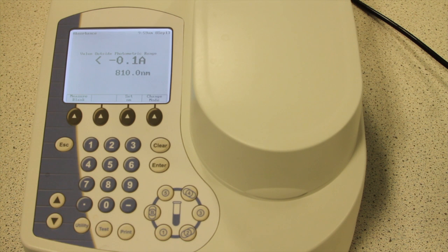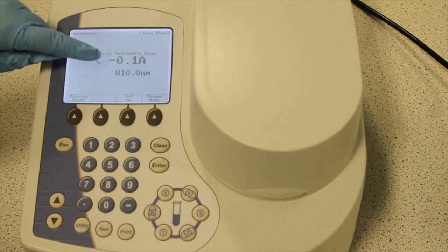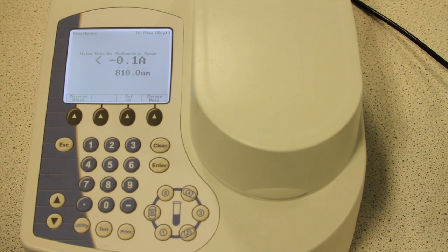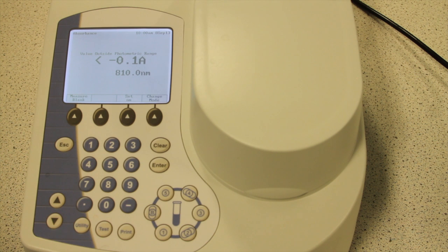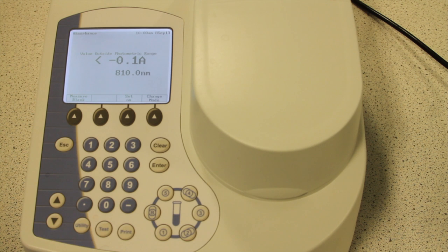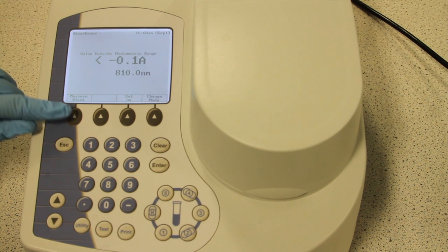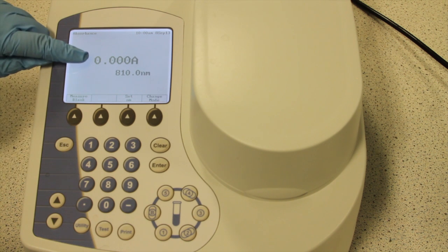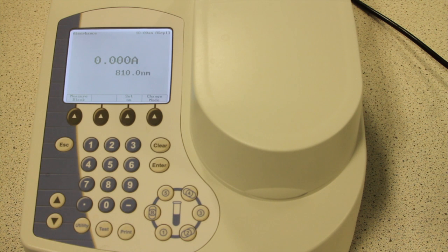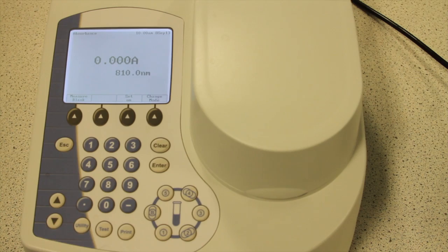The display will now show you the absorbance of the pure water and any interfering absorbance from the cuvette itself. In practice, this is a very low value. We want the spectrophotometer to deduct this value from our samples so we will be able to only read the absorbance of the copper sulphate, so press measure blank. The display should now read zero. Don't worry if the number starts to fluctuate a little, as this will not give any significant effect on your result.